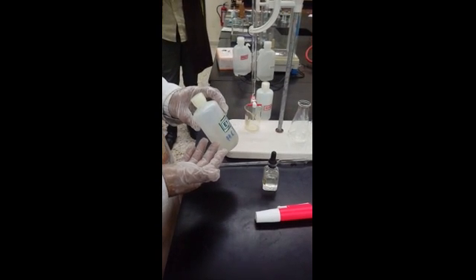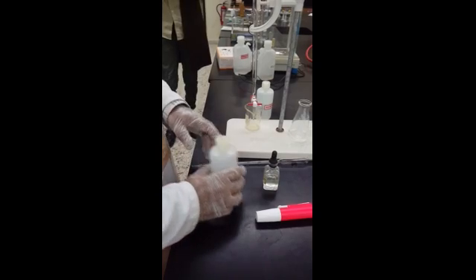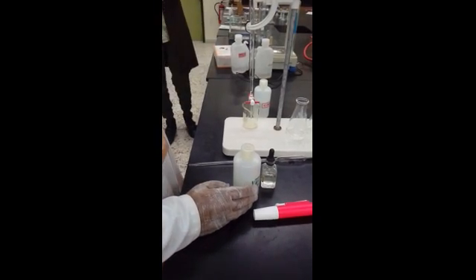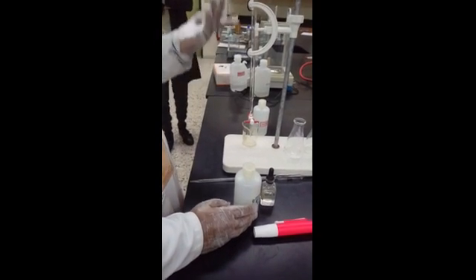Do you have to memorize these things? Okay, fine. And second objective you can say that you want to learn the skills of performing acid-base titration. Fine. Let's start the practical now.